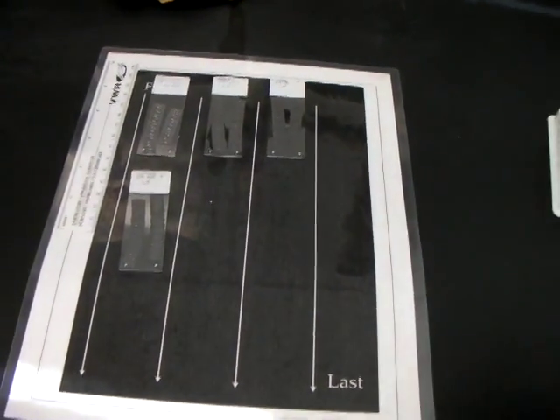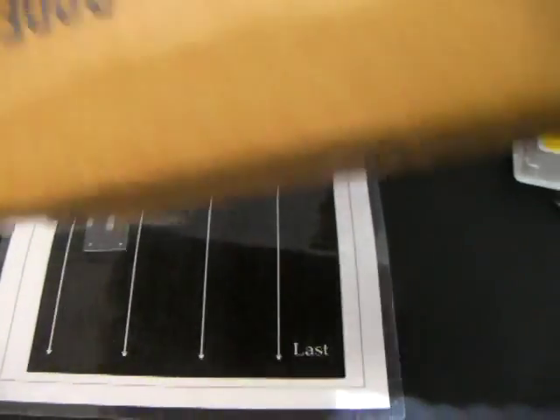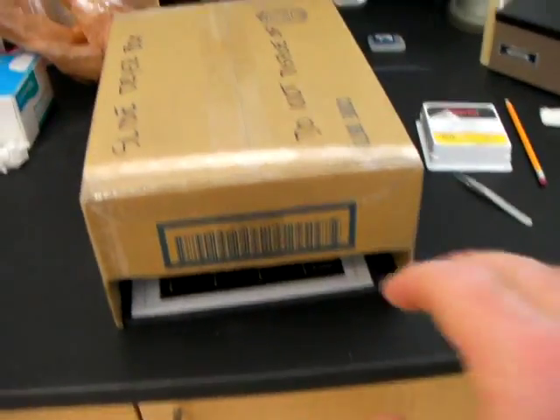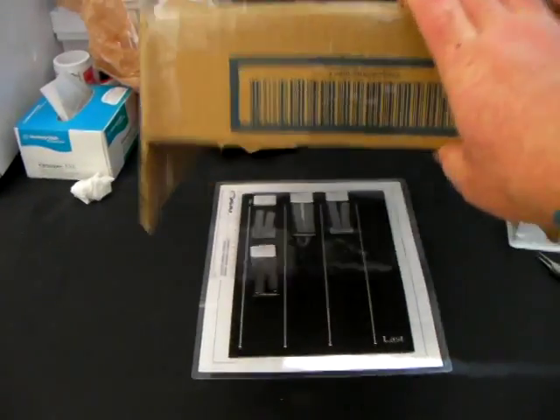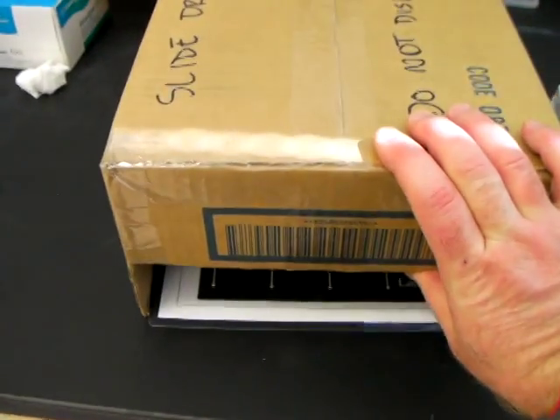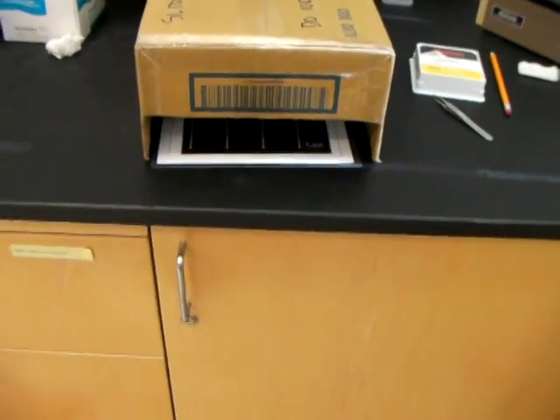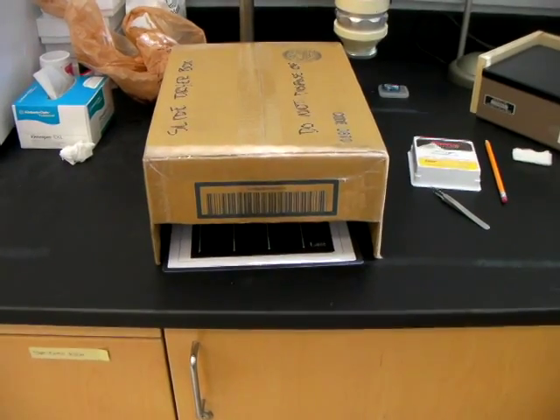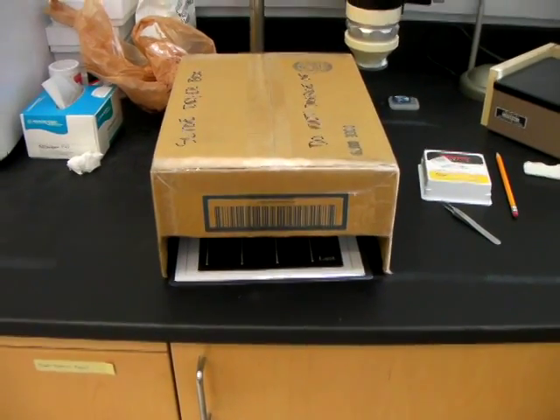It's important that they dry in a dust-free environment, but yet in a place where they can be aerated, so enter the makeshift drying box. It's just perforated on the bottom on both sides, so the air can flow through, and yet it provides a dust cover for the slides as they're drying overnight. Let them sit overnight, and they should be good for staining in the morning.